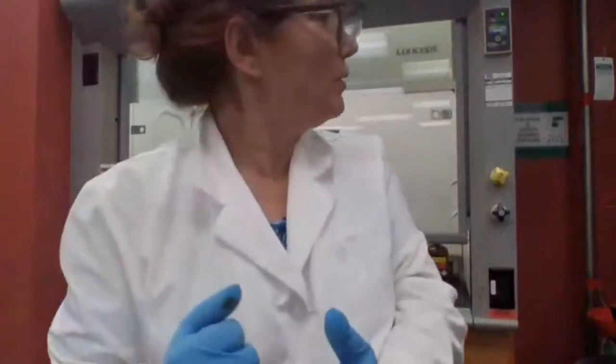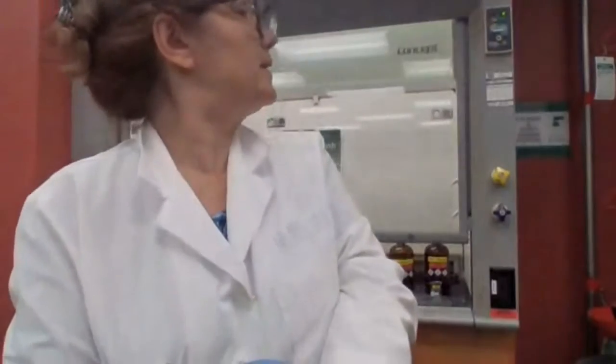There is no phenol out. Probably I didn't ask for phenol. Let me see what experiments we have for phenol.